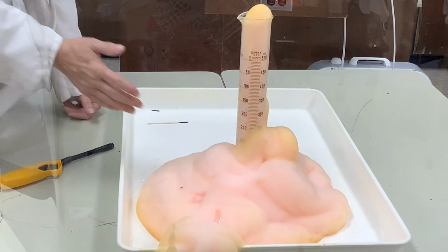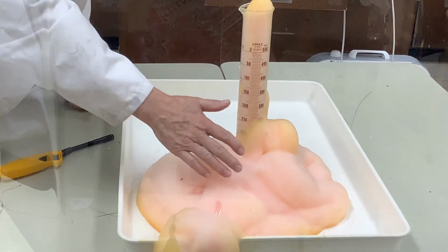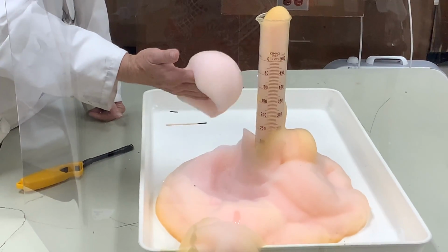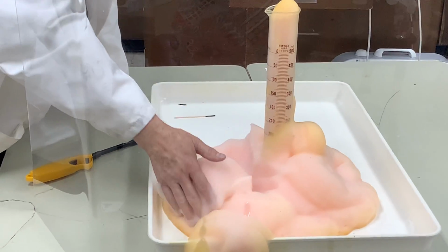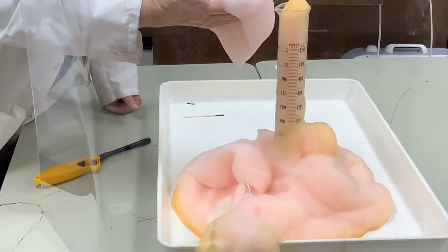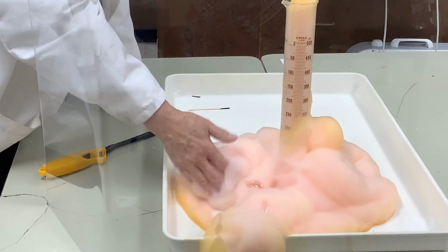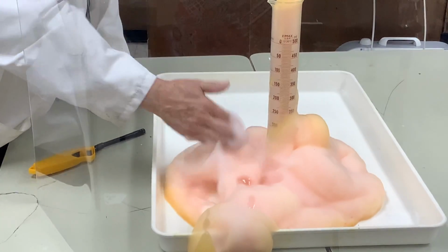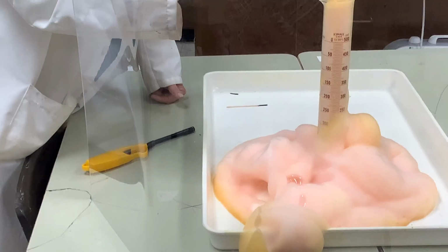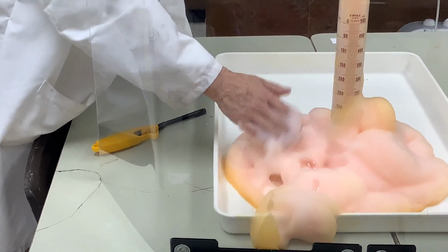Everybody wants to touch the foam. I don't allow people to do it. If you do, you should wear gloves, because there may be some unreacted hydrogen peroxide that comes through. I know where my sink is, and I know where relief is if I should get some on me, because it will burn, and if you had an open cut, it would burn immensely.